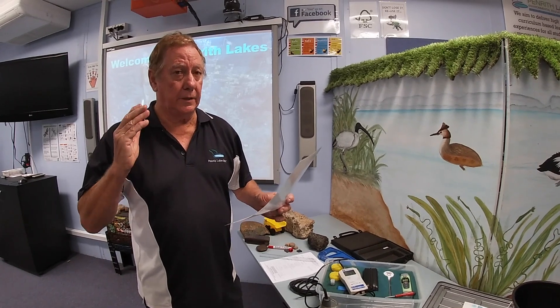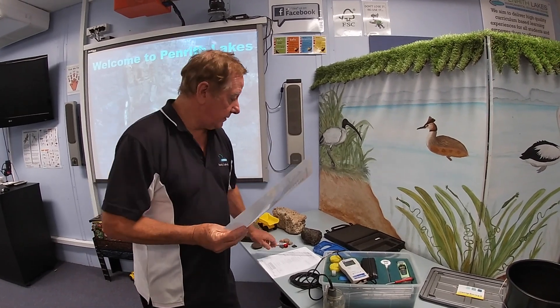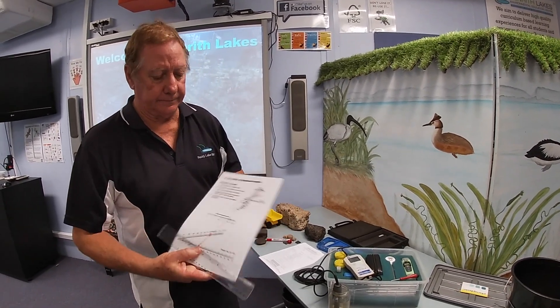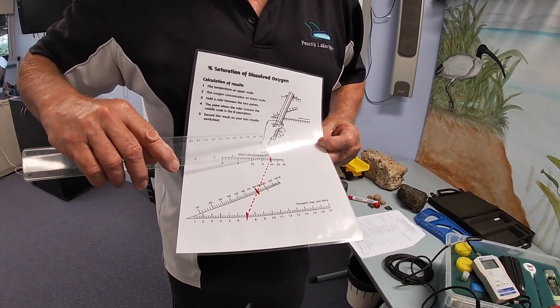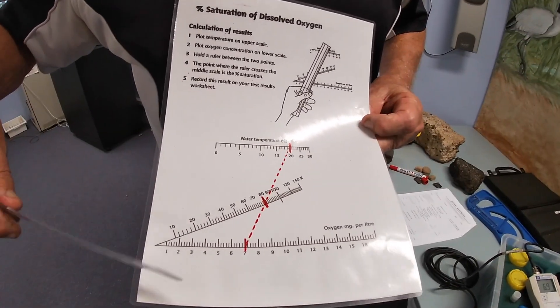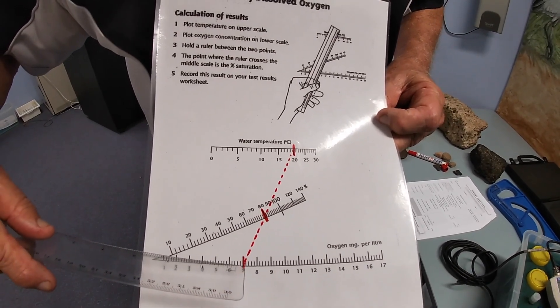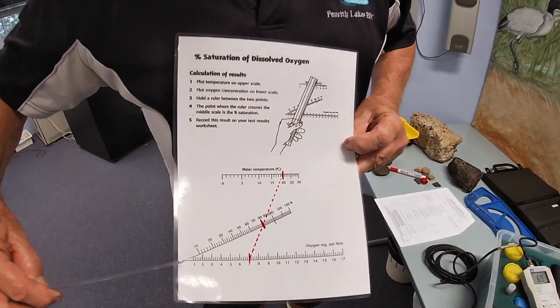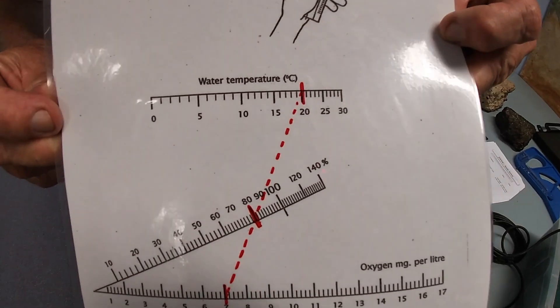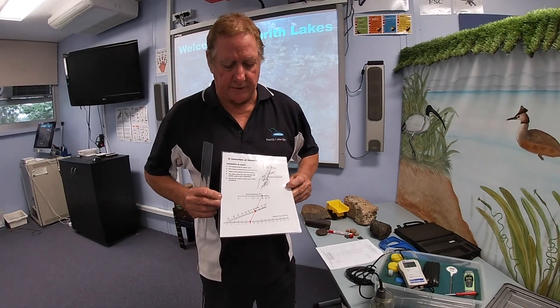We simply use this chart. We need two variables: water temperature and the milligrams per litre reading which we just took off the oxygen meter. This chart has got those two variables on it. At the top we have our water temperature which we recorded earlier at around 20.3 degrees. We also just recorded the oxygen level at about 7.2 milligrams per litre. We place our ruler between those and where it crosses the diagonal line is where you read your percentage saturation oxygen.